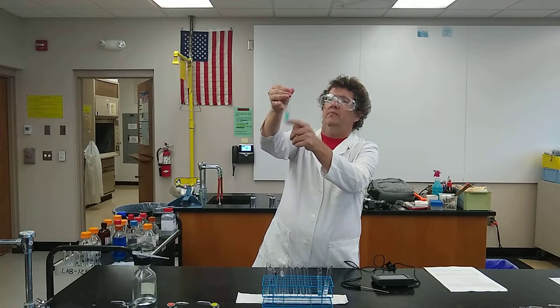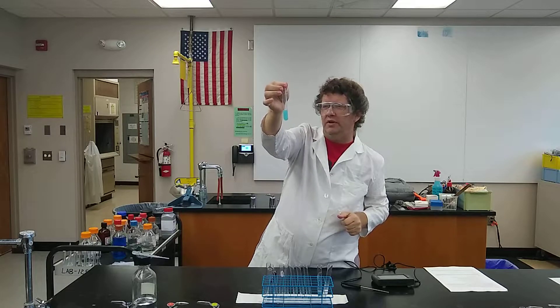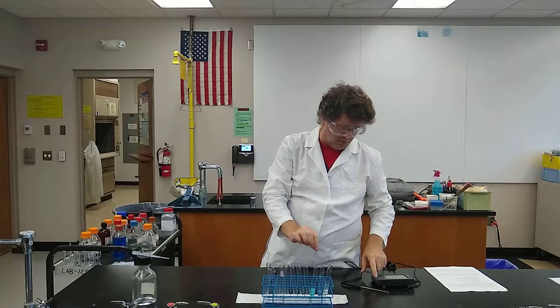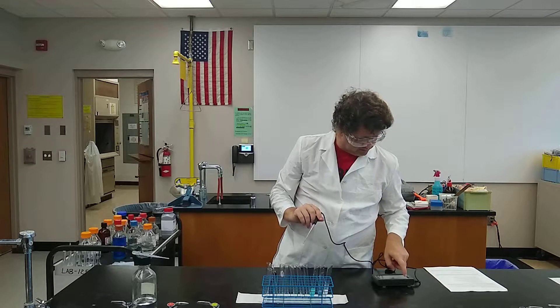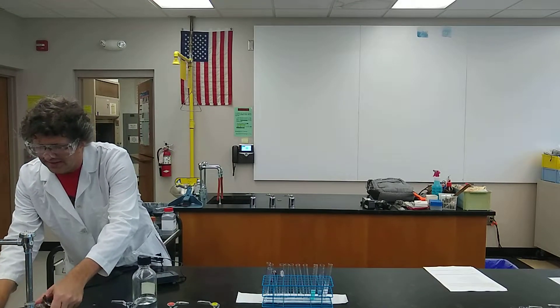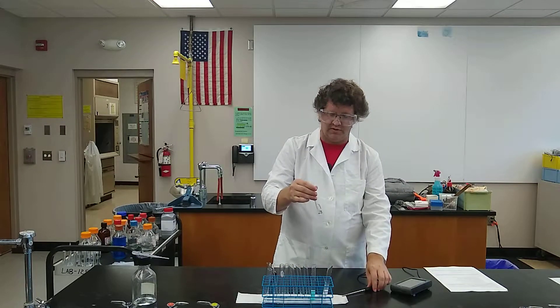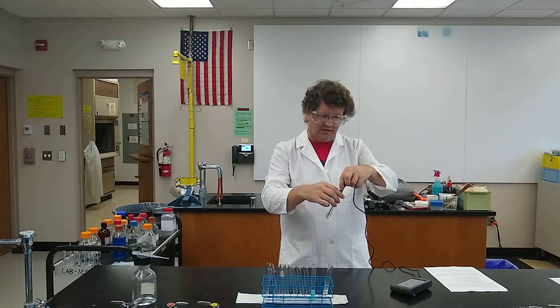Let me hold this up — it's definitely got a powdery substance to it. It still has the blue from the liquid, but the precipitate does look white. We're going to let that sit and check it in a moment. I notice just by touching it, this one actually feels a little bit cooler. It's dropped to about 21 degrees, so barely a temperature change, but it is a little bit lower than it was — that is an endothermic process as they're mixing.